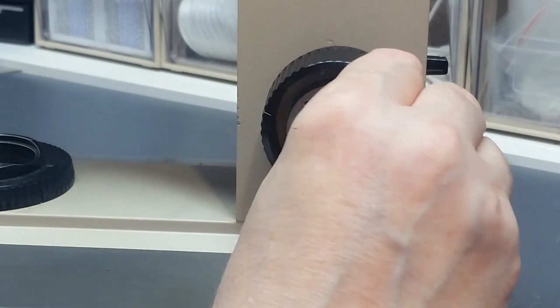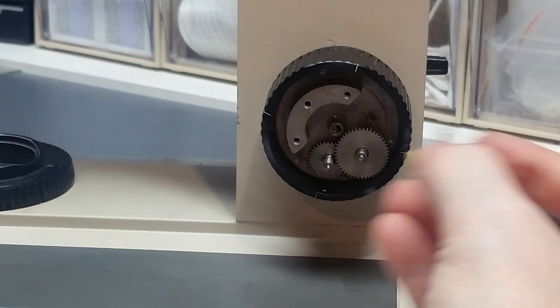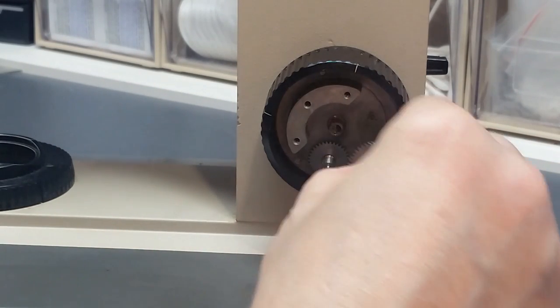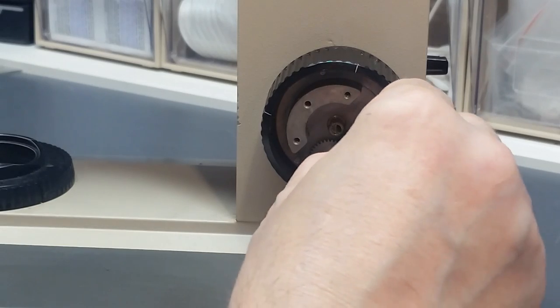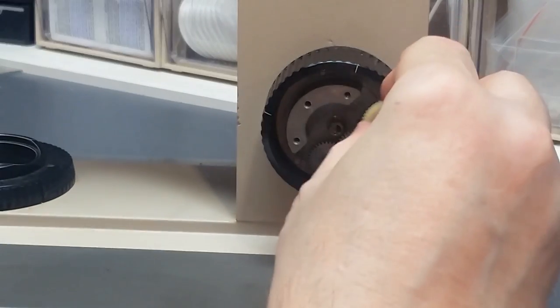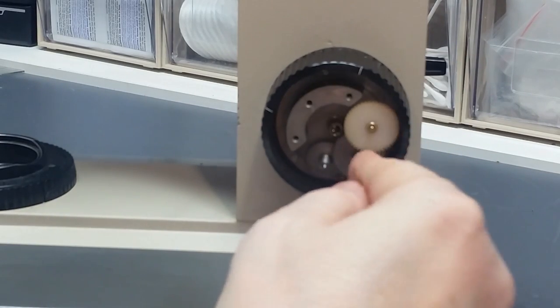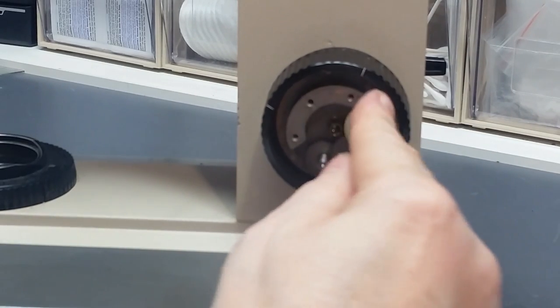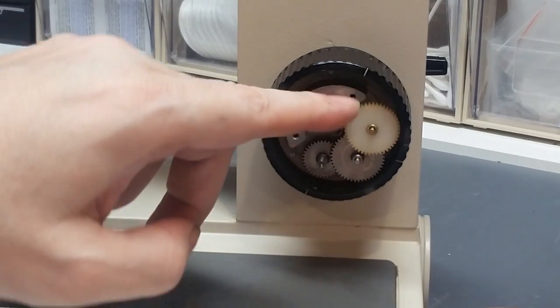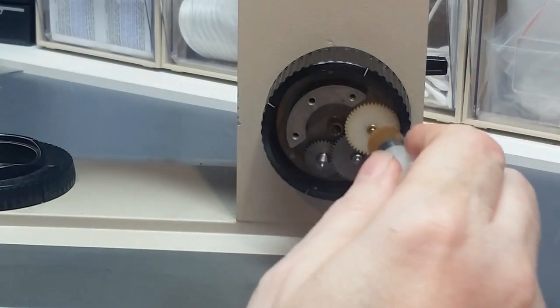And wiggle it around until I can find the hole. It's totally covered in grease, that's why I can't see it. There we go. Make sure these gears move freely, no binding. Everything feels really good. Okay, take a little grease.